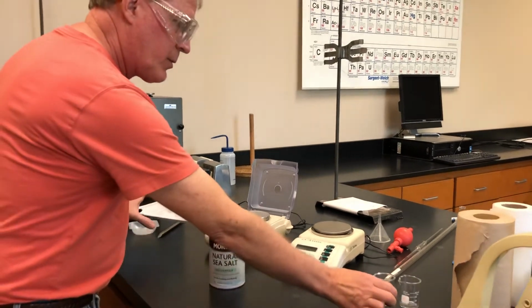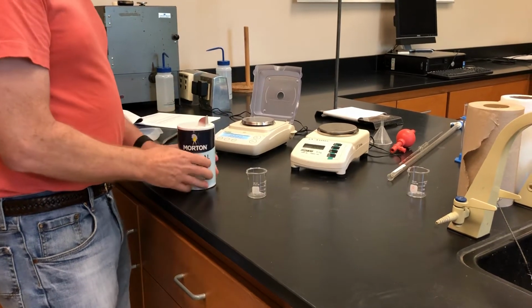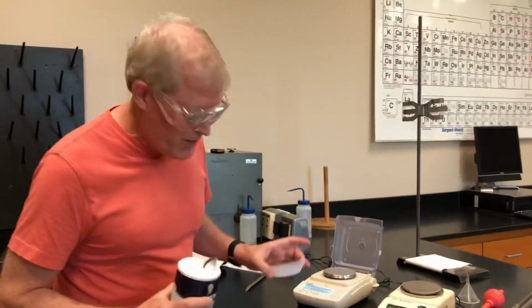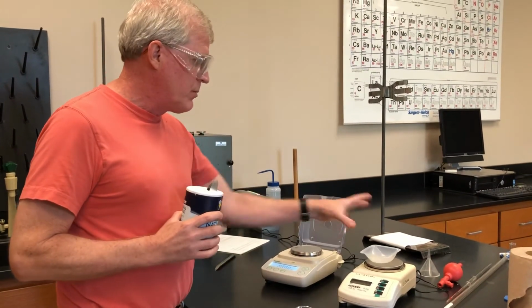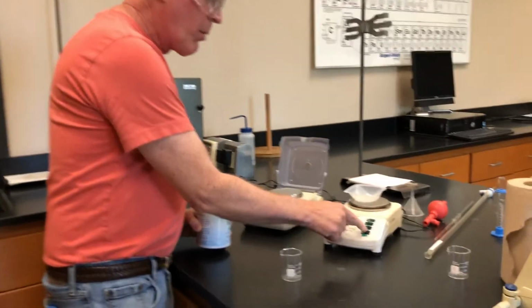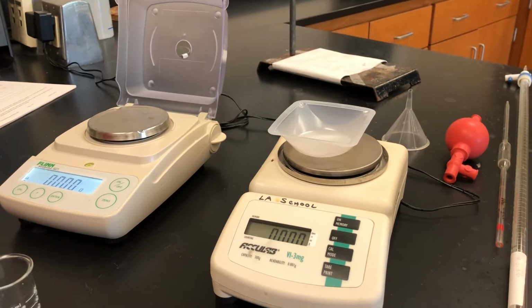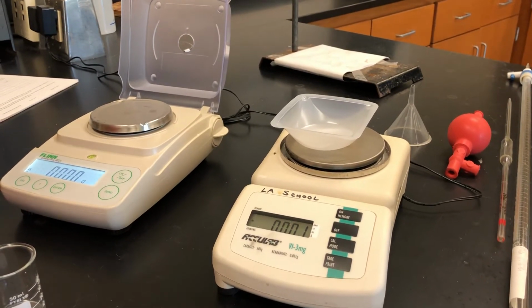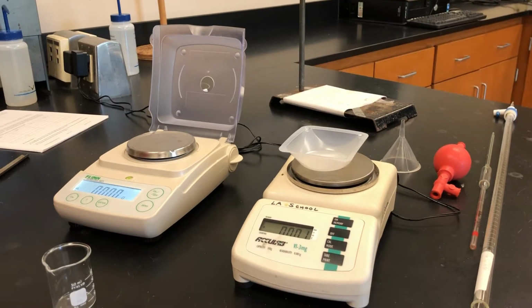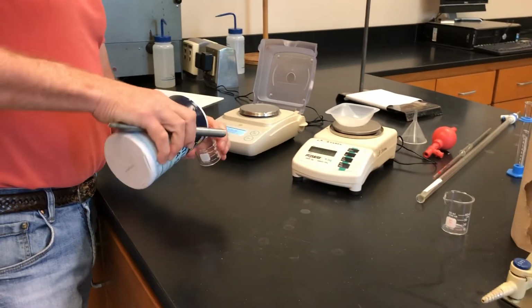So what I'm going to do is pour some salt into a beaker, okay? I hesitate to pour this out. What you do not want to do, okay? A lot of people will be tempted to put a beaker or a weighing dish on the electronic balance, and you can always hit your tare button and set it to 0. That way I don't need to worry about the mass of the actual weighing container itself. A lot of people will be tempted to just pour their chemical into their dish. I typically don't like to do that because you don't know if you're going to spill it everywhere. And so that's why I'm going to pour some salt into a beaker.